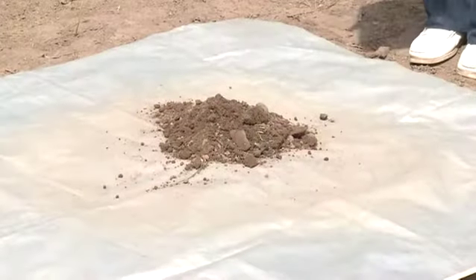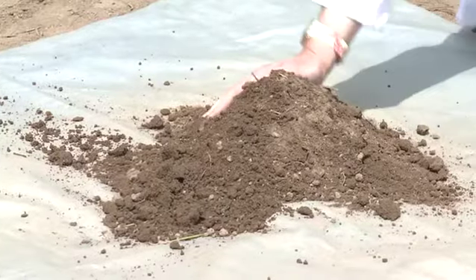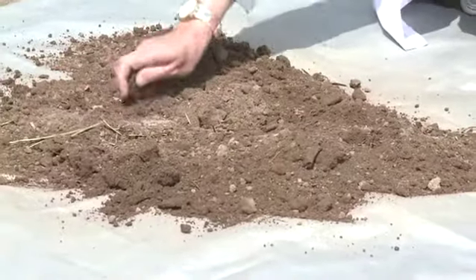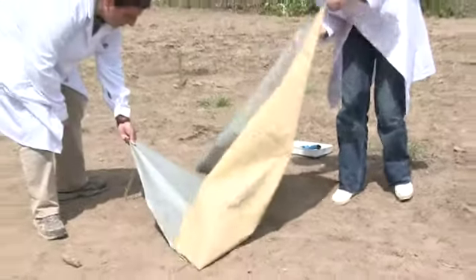If, after mixing all the soil samples, the amount collected is still too large to be transported to the laboratory, we should then repeat the procedure and select a smaller subsample by quartering. All the samples should be put on a canvas sheet, mixing well the soil.